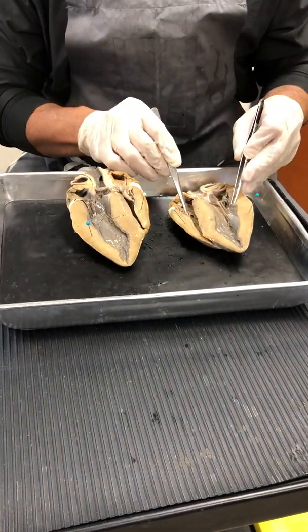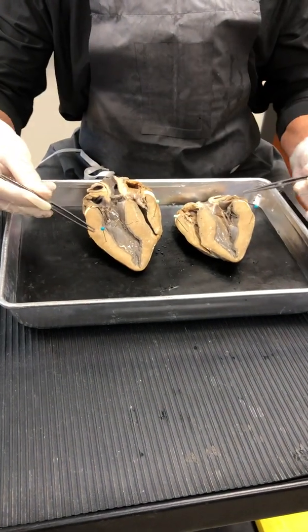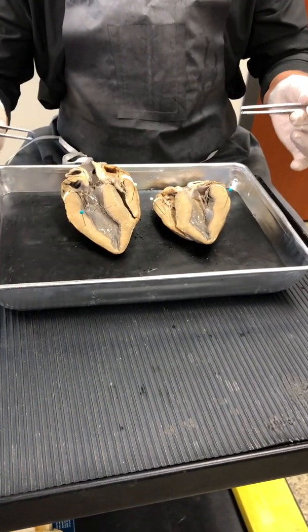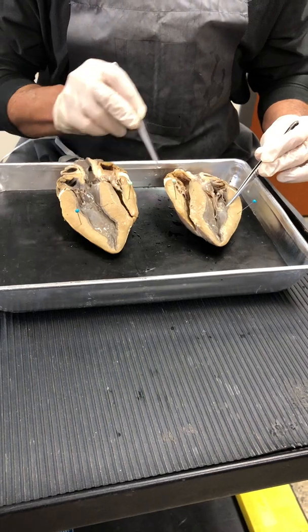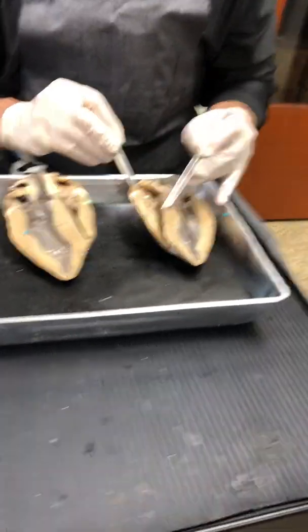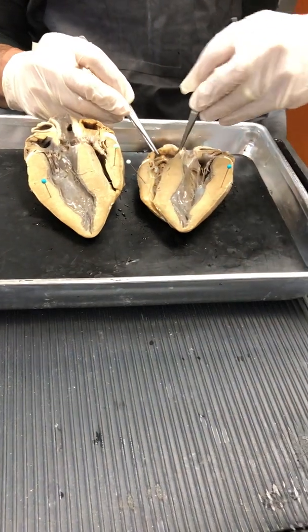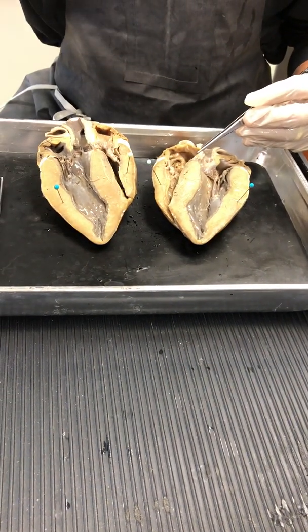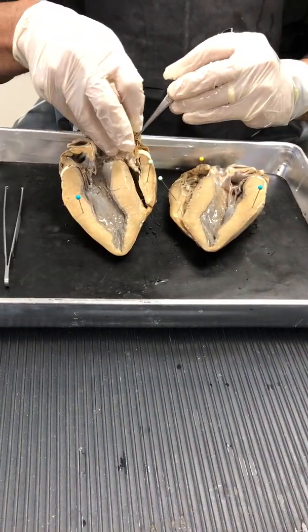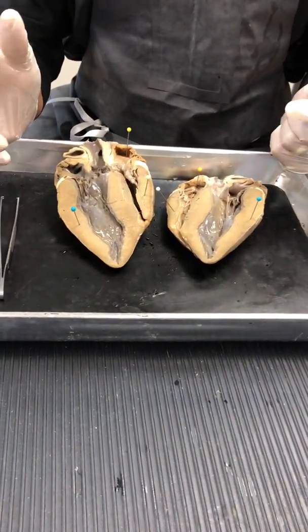So the first thing you do before you do anything else is establish left versus right side. Left side, right side. And now I can't go wrong. So now I know what is left side, etc. And now, my advice is you figure out what is comfortable for you. But if you want to find things only one time, then my advice is find the right atrium. So there is the right atrium there, and there's the right atrium there. So I'm ignoring everything else. I'll find the right atrium after I've determined left and right side.